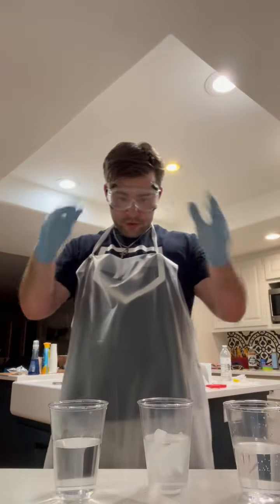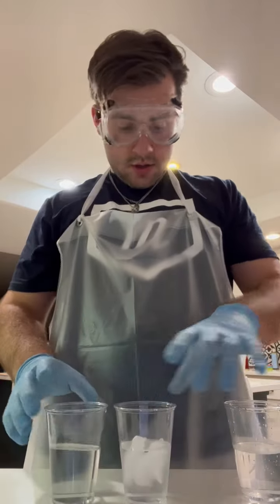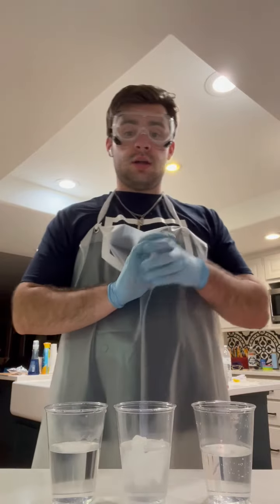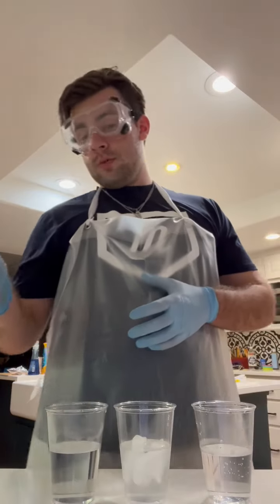All right, I got my 3 cups with the 3 waters, and next thing I'm going to do is put the same solutions that I put together in activity 2 in a test tube, put them in each cup for 5 minutes, and we'll see what happens then.